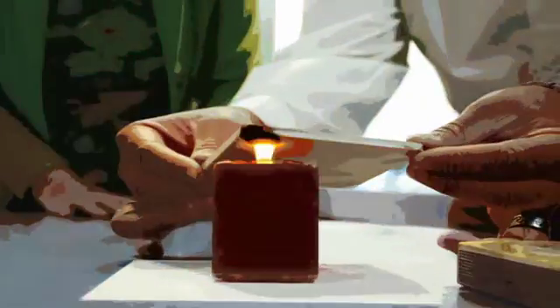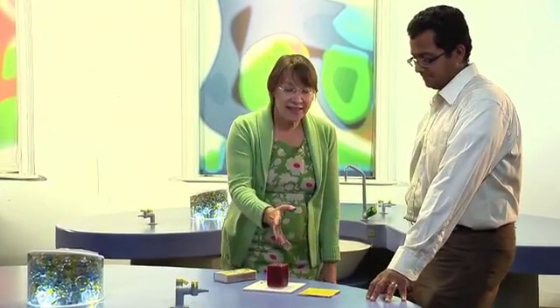This experiment is an example of an irreversible reaction. Unusually, it's a gas turning into a solid. What I want you to do, Jay, is to light the candle.